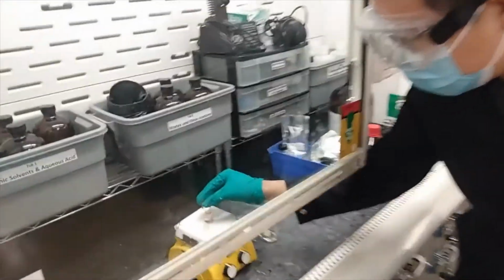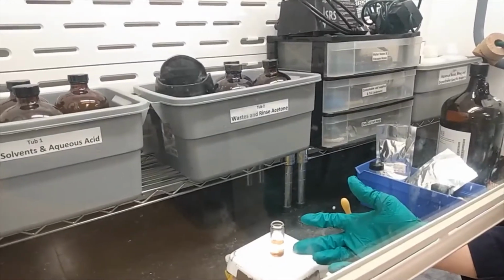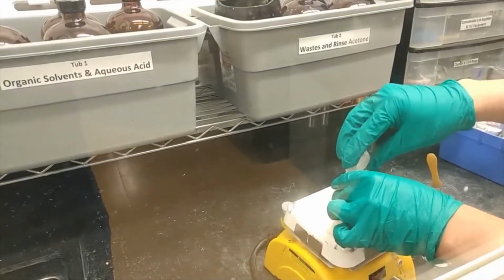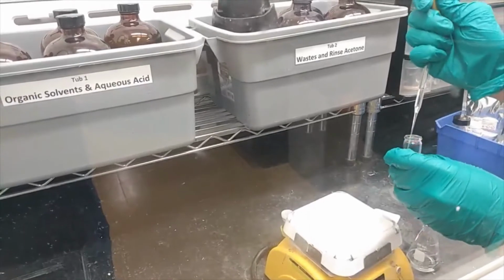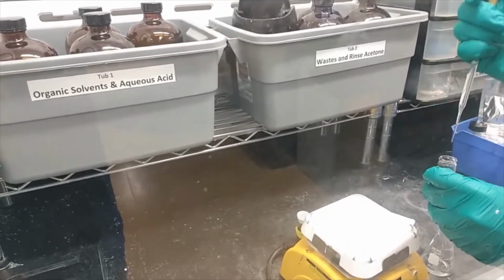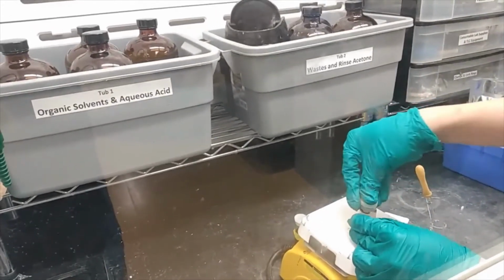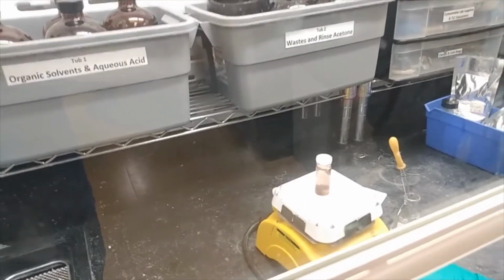Okay, so here we have already added the two reagents in the small vial, and also I added the petroleum ether to the halfway. So now I'm going to add the wax dispersion of Grubbs catalyst very quickly to the small vial. Then I will add the petroleum ether till the vial is full, but remember to save the space for the cap. Then we cap it tightly and let it stir at room temperature for at least 24 hours. Then we are going to isolate the product.